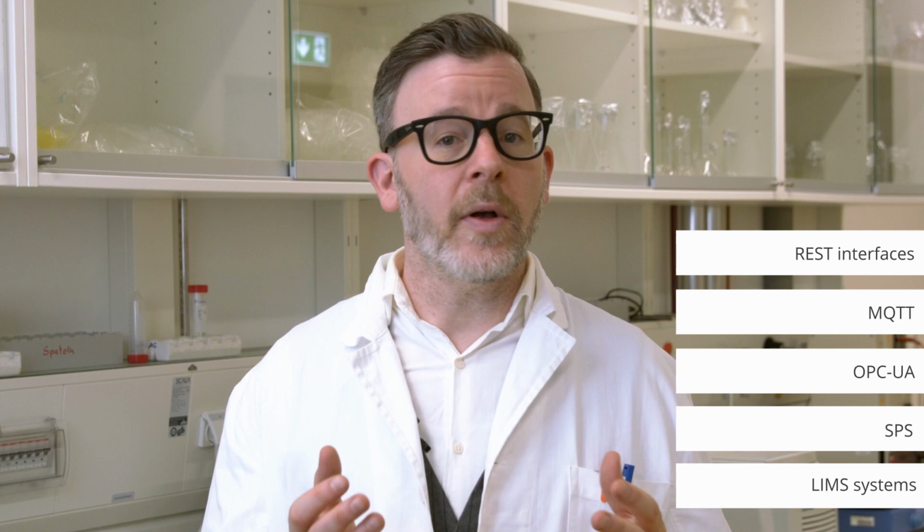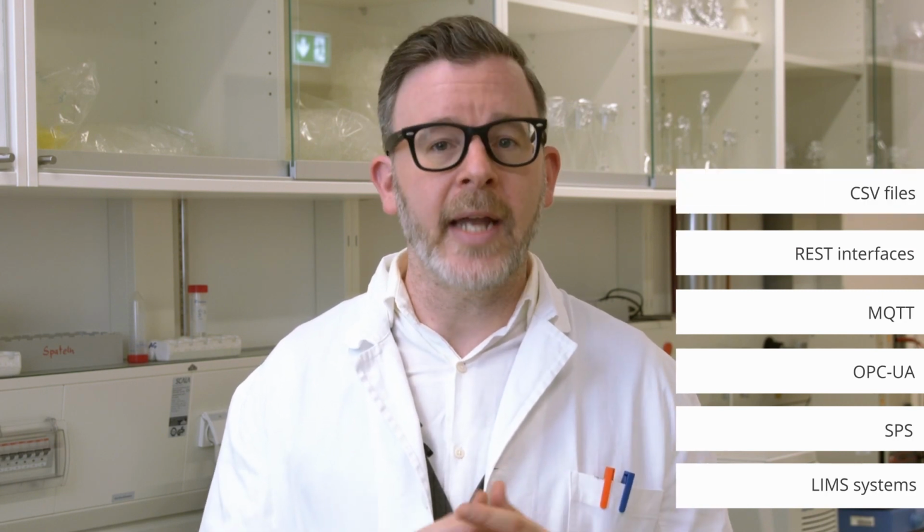She keeps in touch with your internal company's software network, LIMS systems, and is ready to use interfaces like SPS, OPC.UA, MQTT, and different kinds of REST interfaces. She's also ready to produce CSV files and direct database connections. As you can see, she's not just a pretty face. Of course, she can also adapt to your company's software needs.